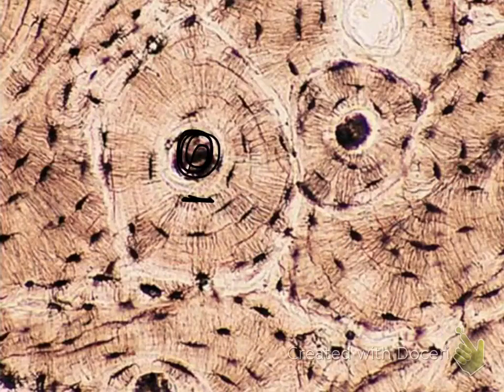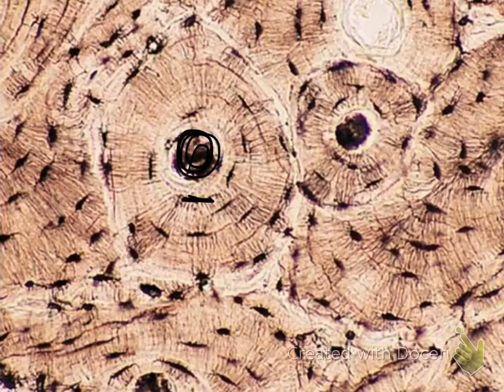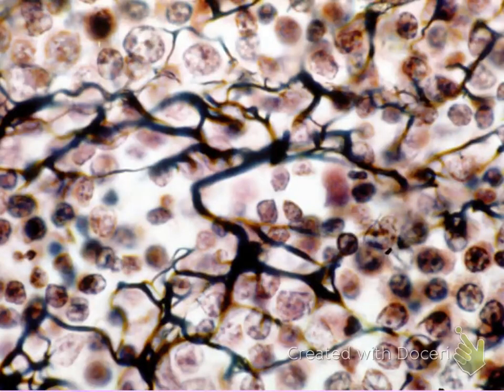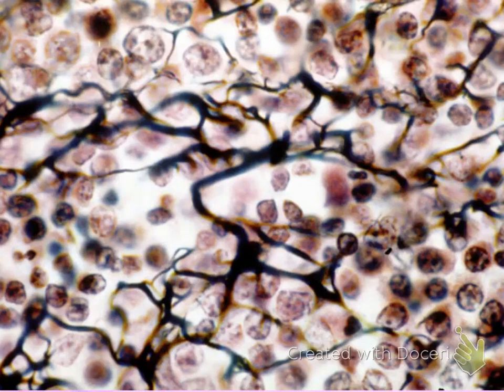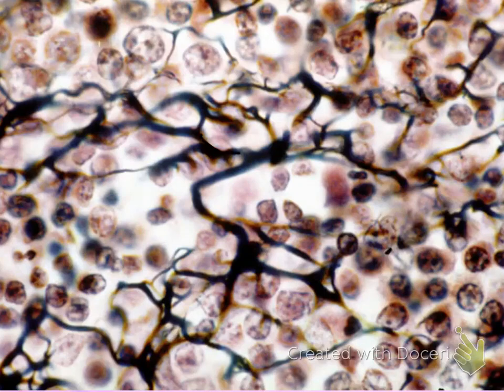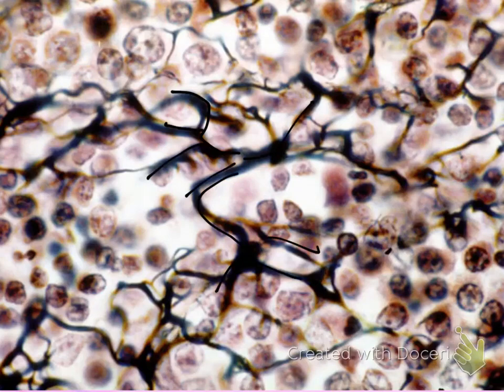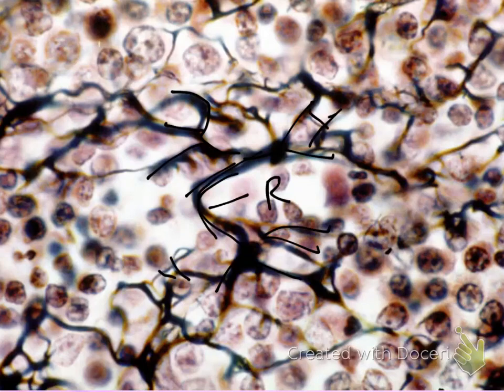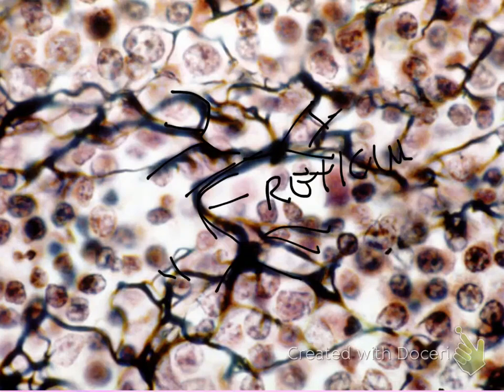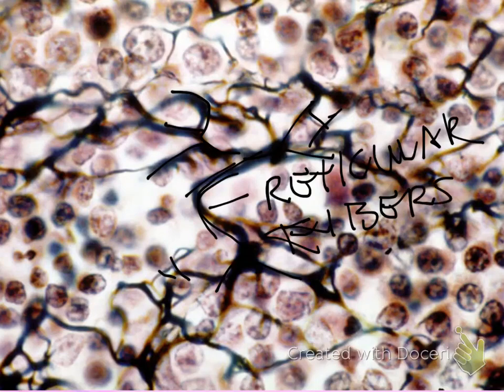Canaliculi means tiny canals. The lighter area in the background is your ground substance, made up of calcium phosphate. The first thing you notice about the next tissue is highly branched fibers running through it — almost like branches of a tree. These are your reticular fibers. When you see reticular fibers, you know you are looking at reticular connective tissue.